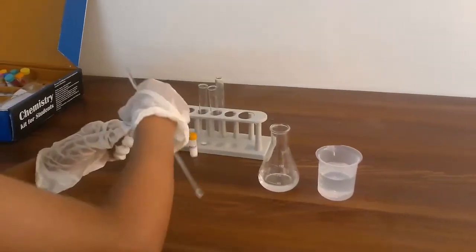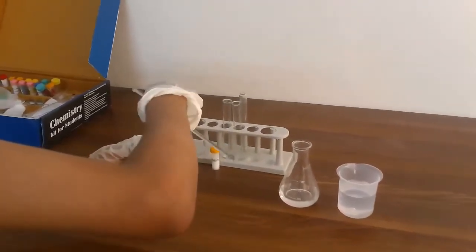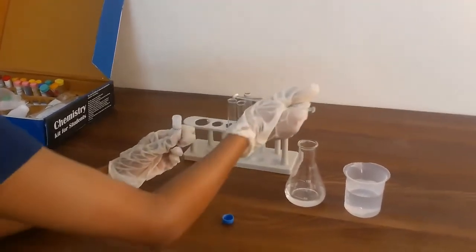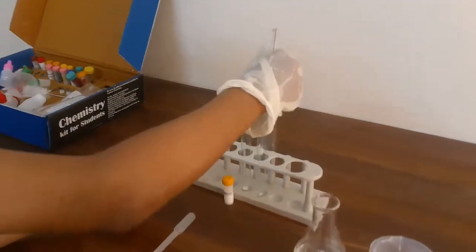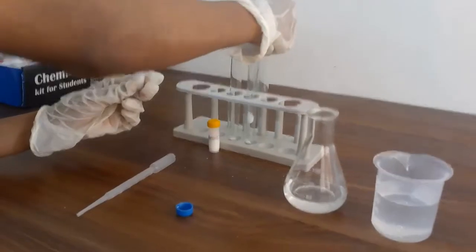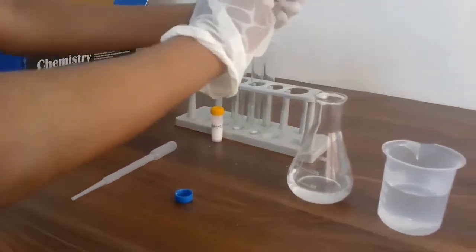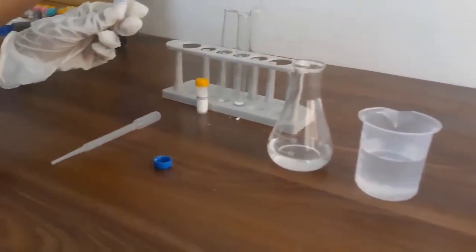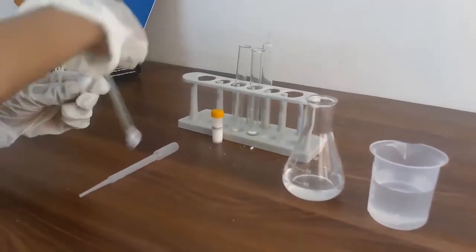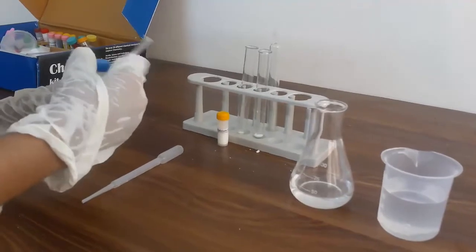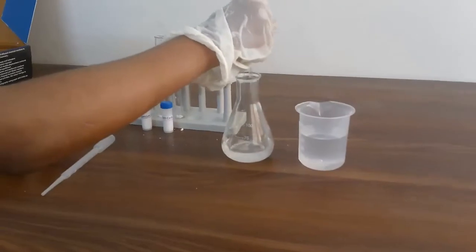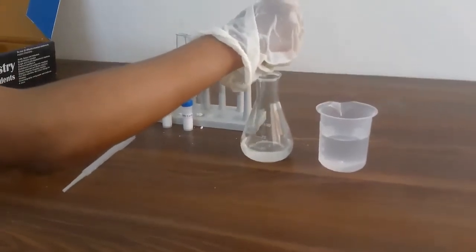And now I'm going to take sodium carbonate, one, two, and three. Now make sure you close the lid. Now then just wash your spatula first. I got mine very dirty as you can see.